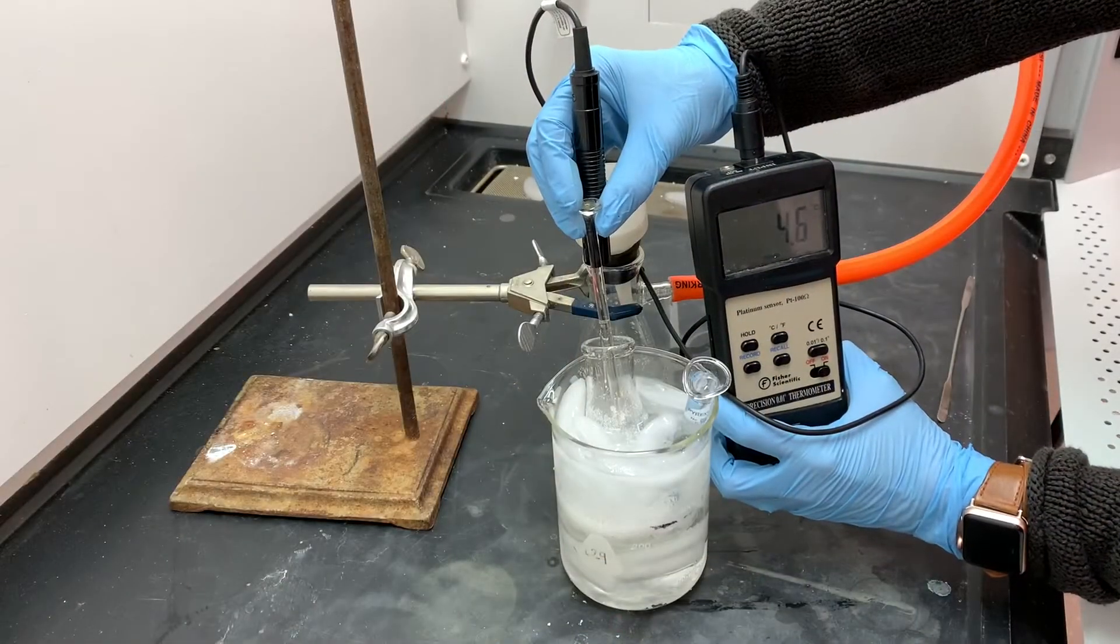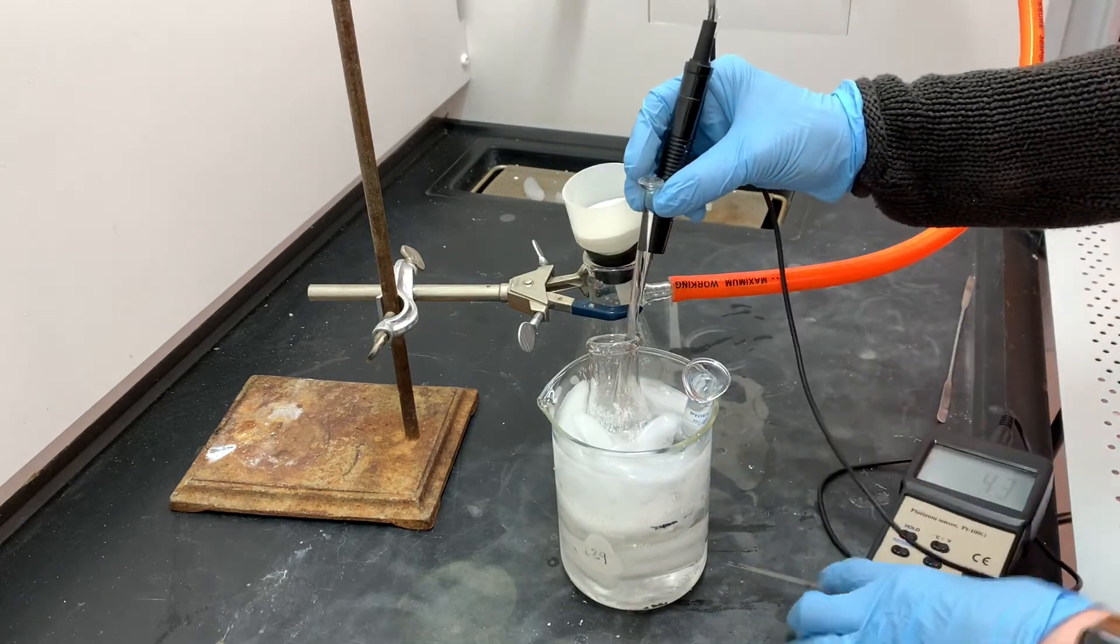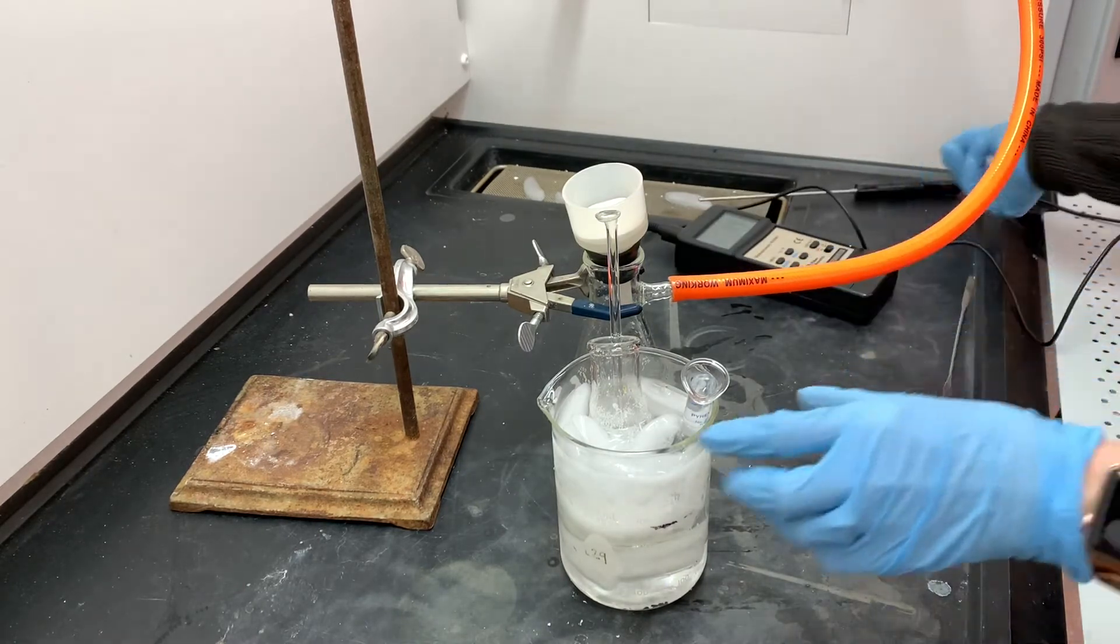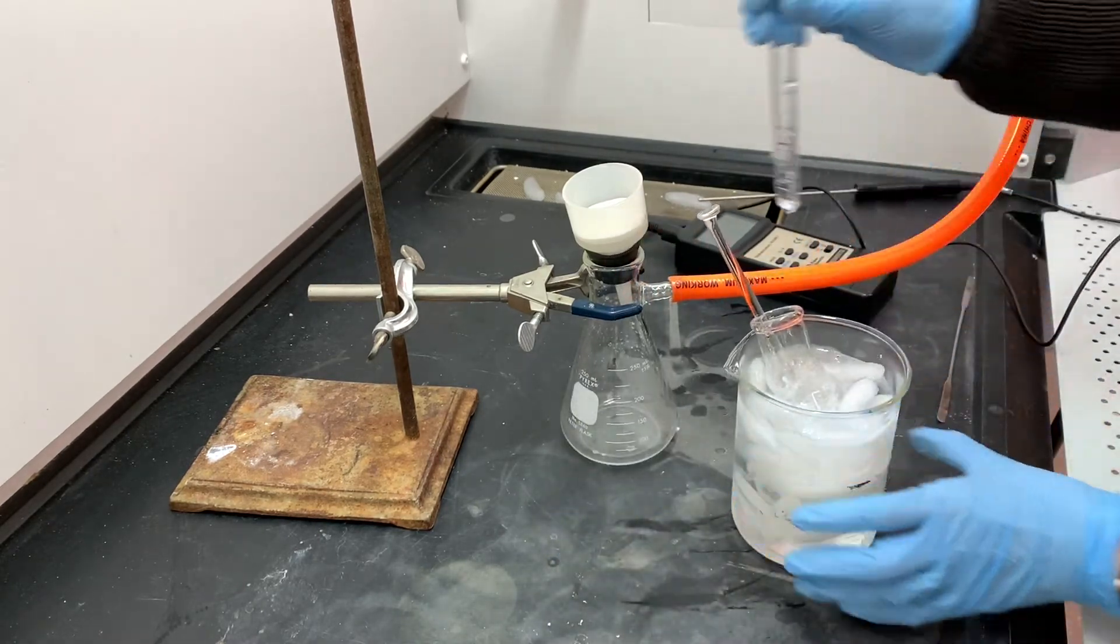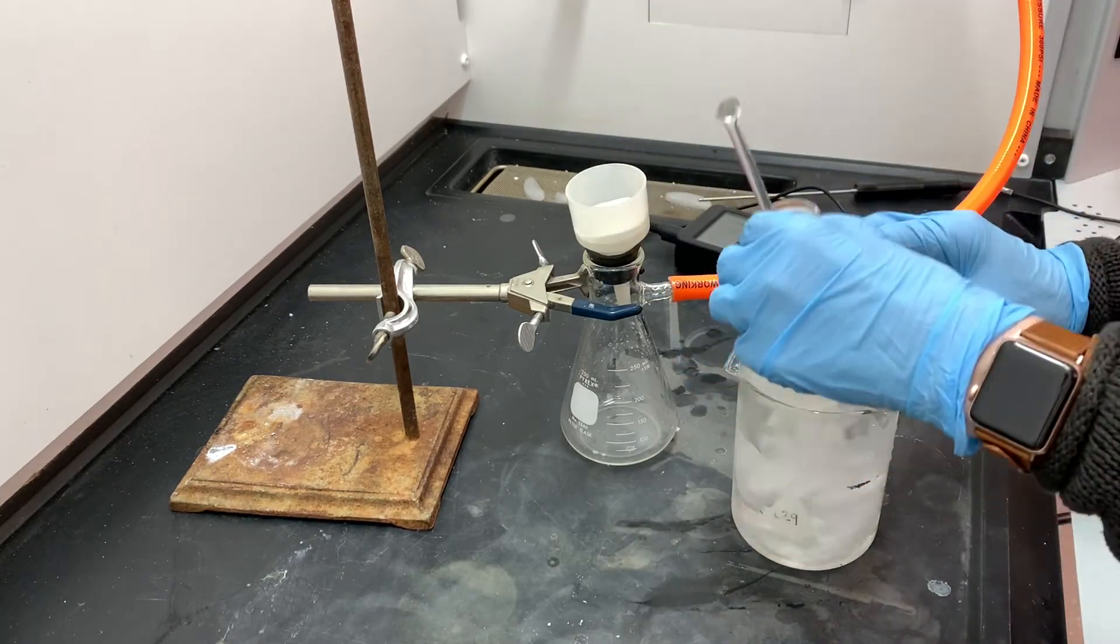The solution has cooled down to below 5 degrees Celsius, which means that it is ready to filter. I'll be rinsing the solution with some ice cold water. Once the solution is done filtering, I'm going to set it aside and let it dry overnight, and tomorrow we will do a purification process.